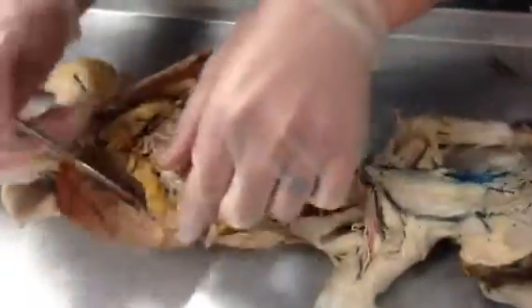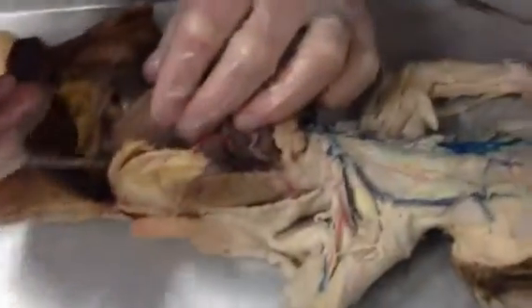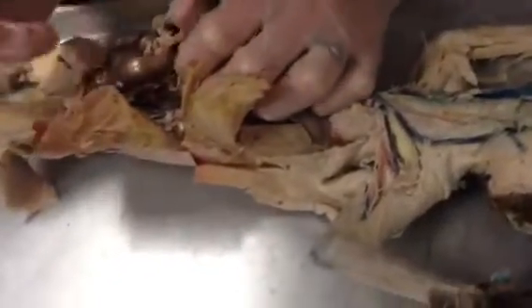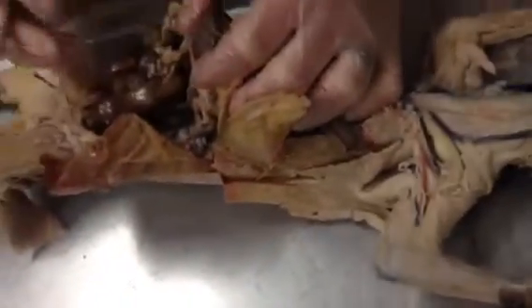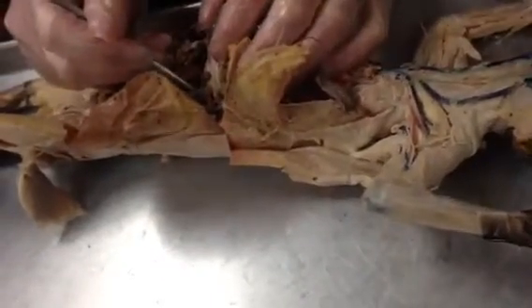Arterial and veins. And so for the aorta, that's going to travel down. So here's the descending aorta right here. And that will then travel down into the abdominal cavity. And, okay, so these are not really well dissected. The first branch off of the descending aorta is going to be the celiac trunk.